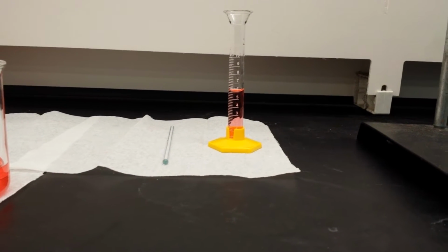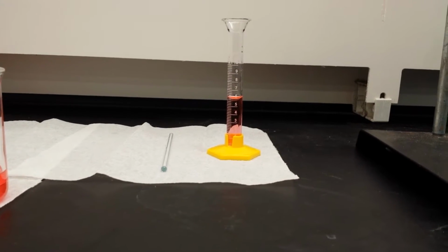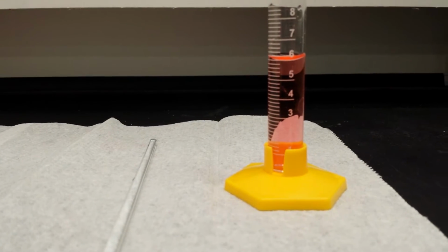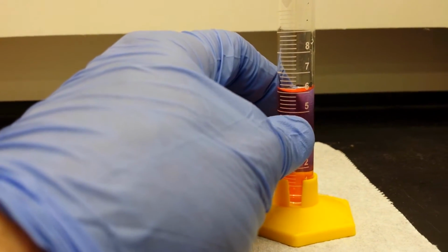Now, this is what I like to call the sucker trap glassware. This seems like it's going to be pretty decent quality. Especially if we come in a little more, you can see that we're in the ones place. We've got decimal markings. Well, it seems that way at first. So we should be able to get decimal places. But not too much.